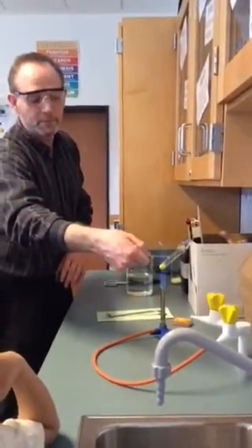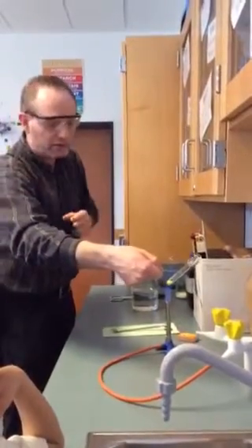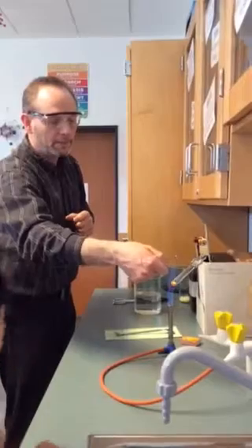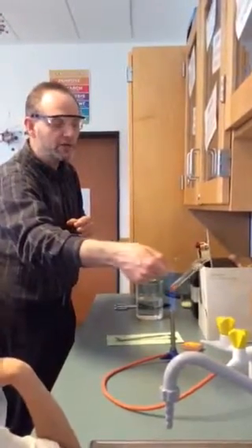It's turning color. It's going to change color. It's going to change a little. How do you think it's going to change? It turned into red. I see it. It's going to turn into liquid. And it is indeed turning into liquid, and it's a little bit of a different color.